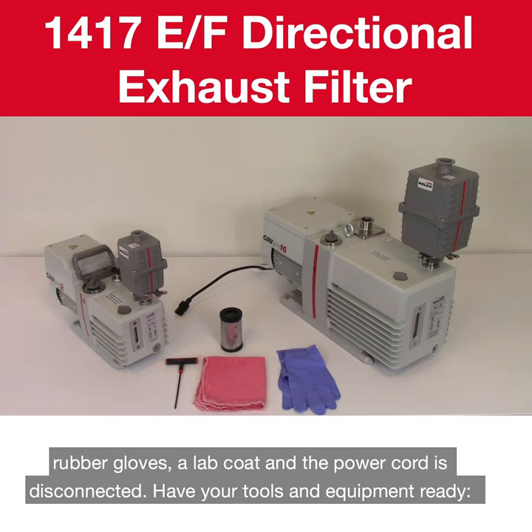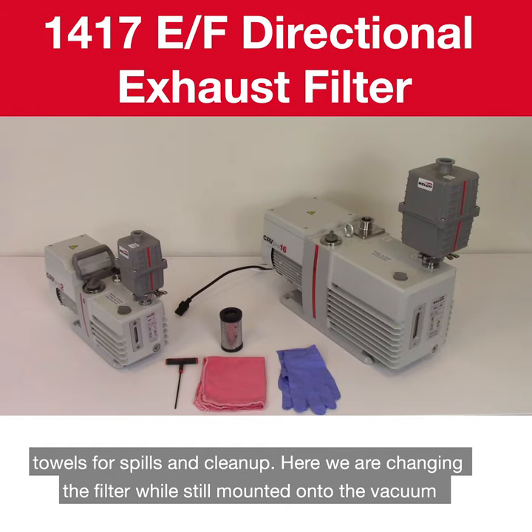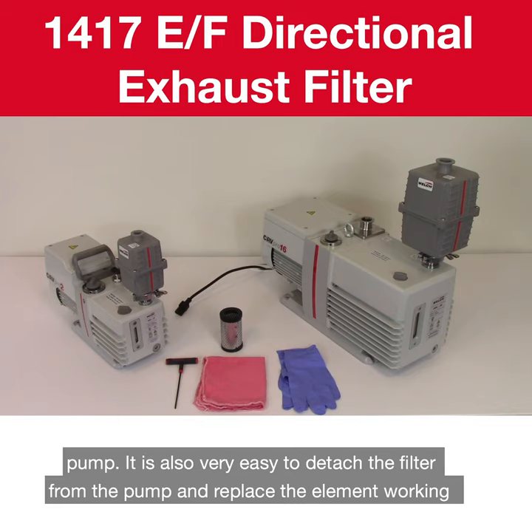Have your tools and equipment ready. The replacement element, a 1/8 inch hex drive for removing the assembly screws, and rags or paper towels for spills and cleanup. Here, we are changing the filter while still mounted onto the vacuum pump. It is also very easy to detach the filter from the pump and replace the element working from a bench top.